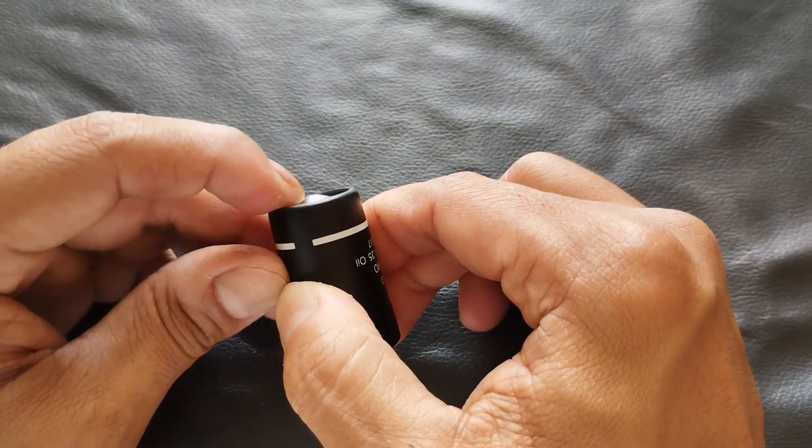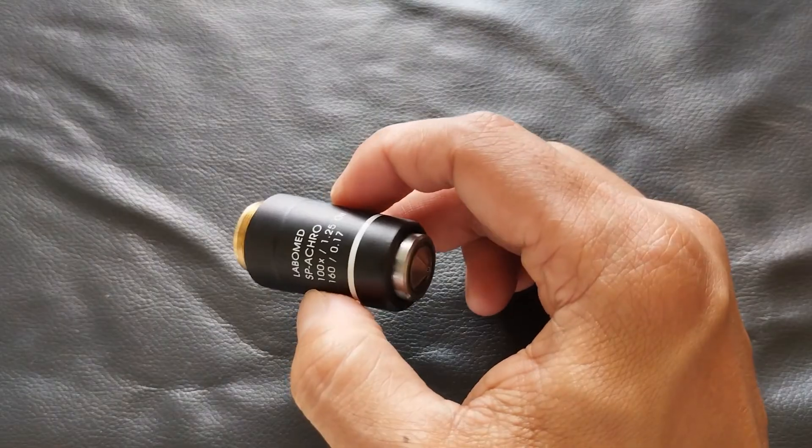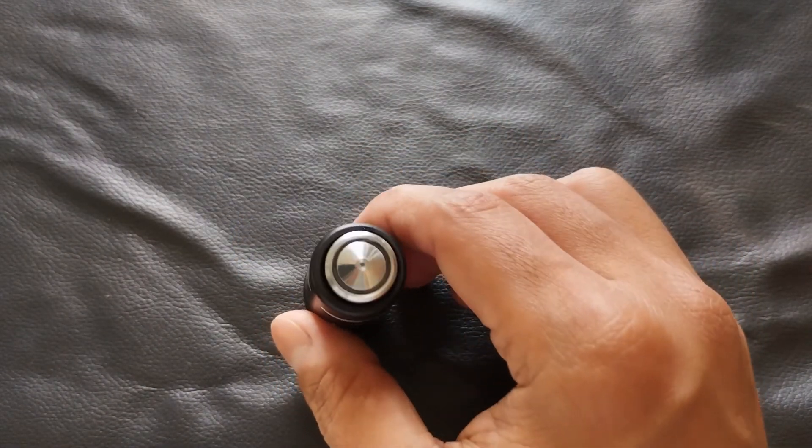Having said that, it is always better to be careful and follow good practice when using high power objectives by using only the fine adjustment knob with such objectives.